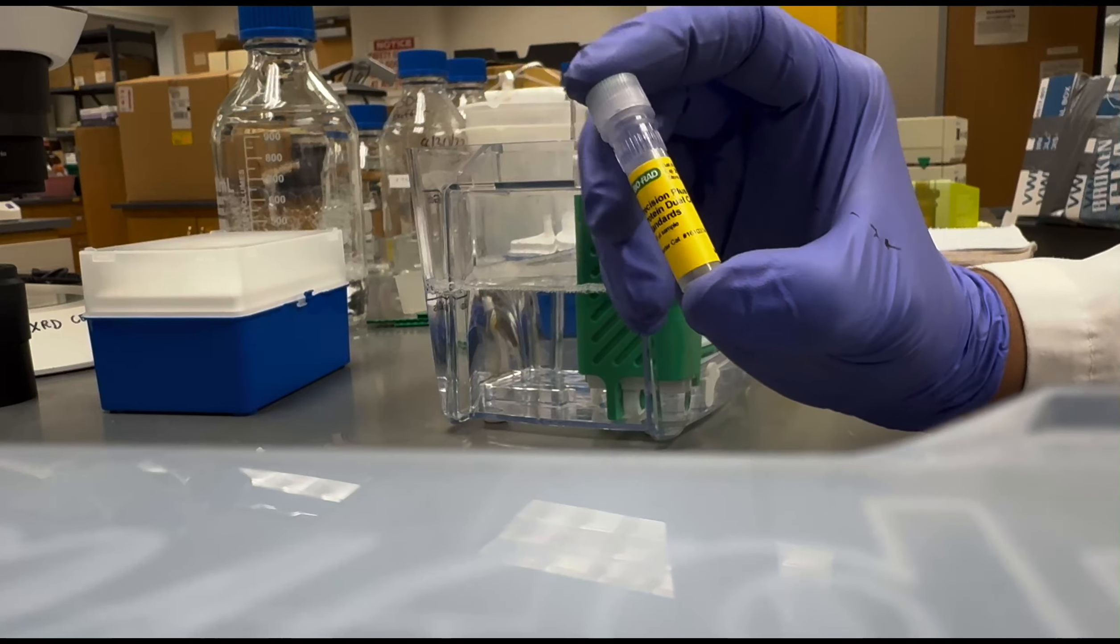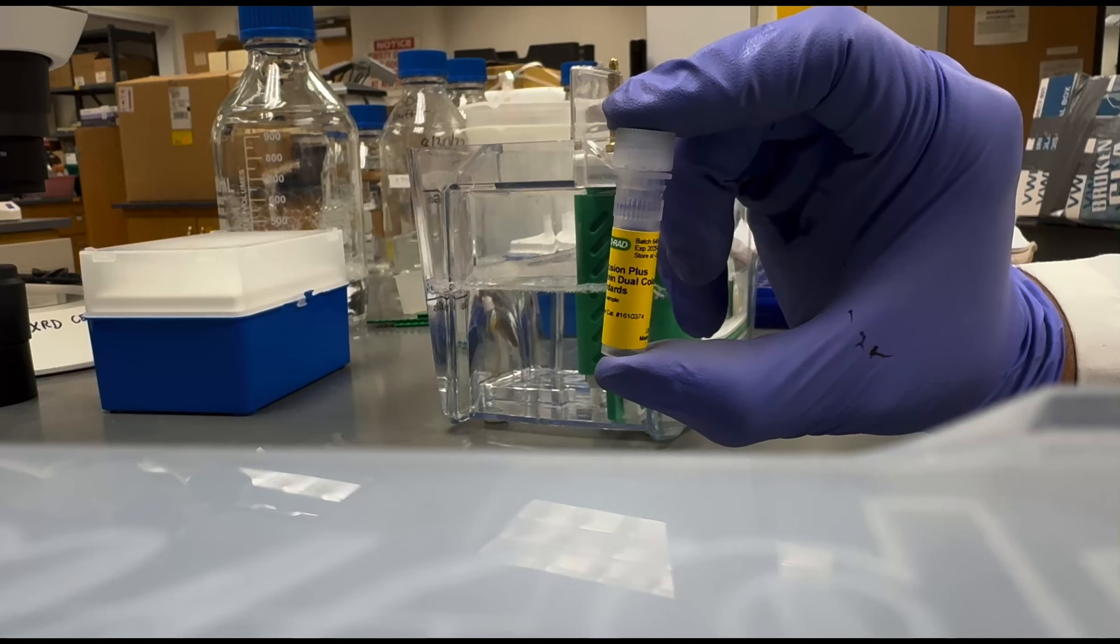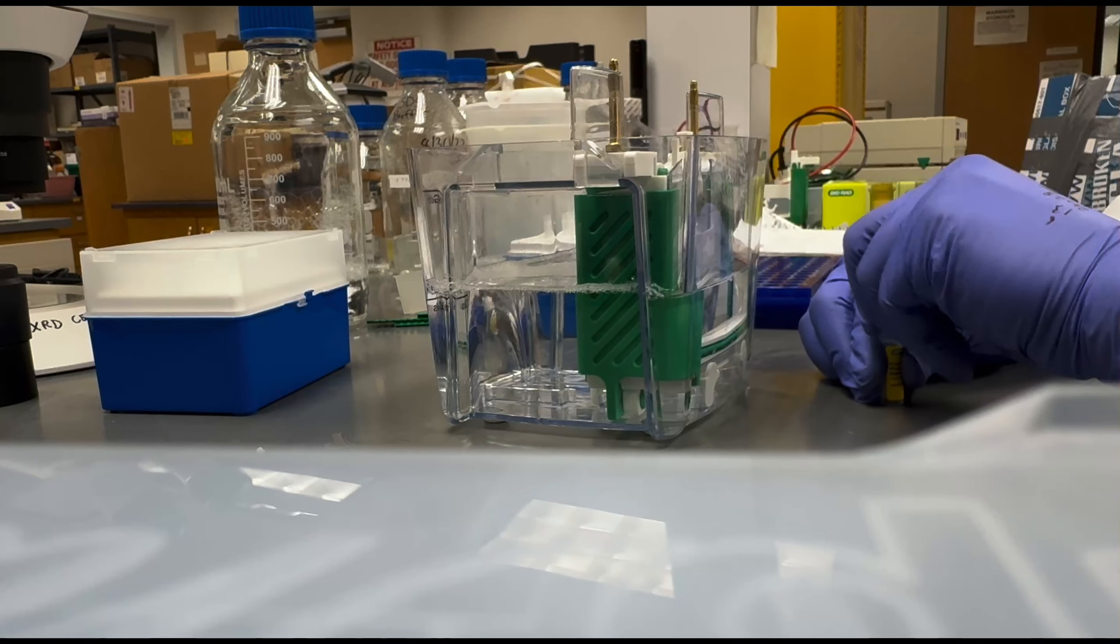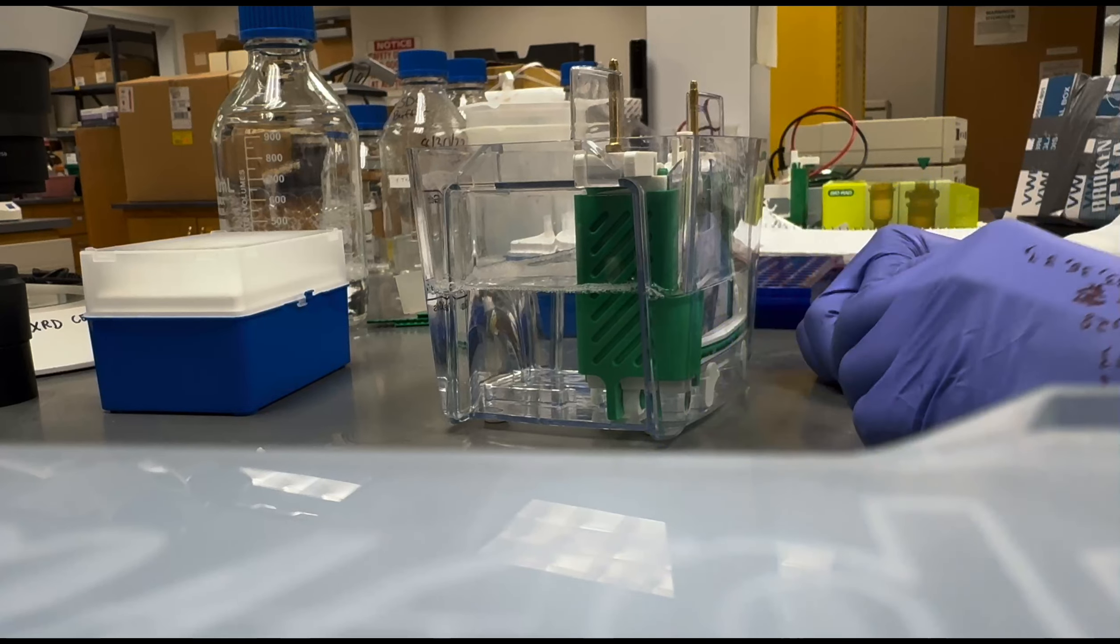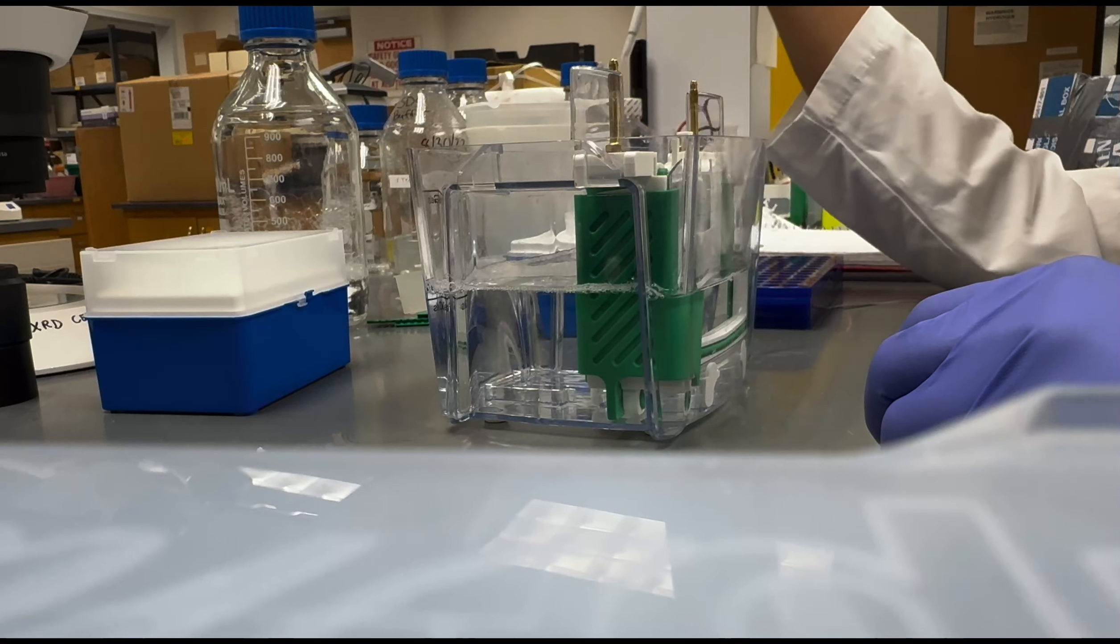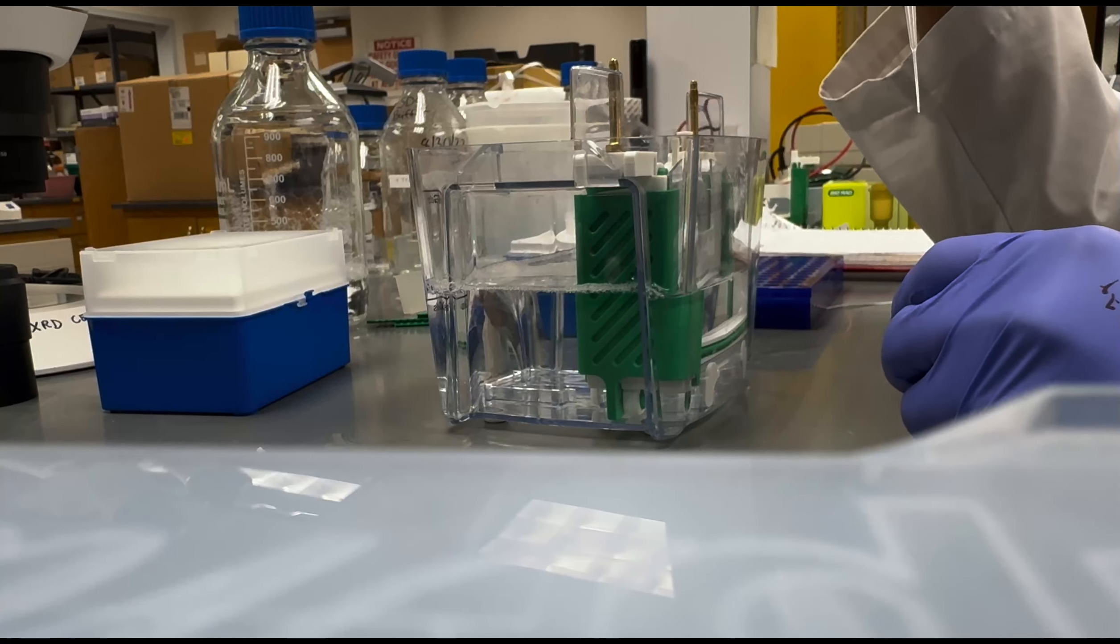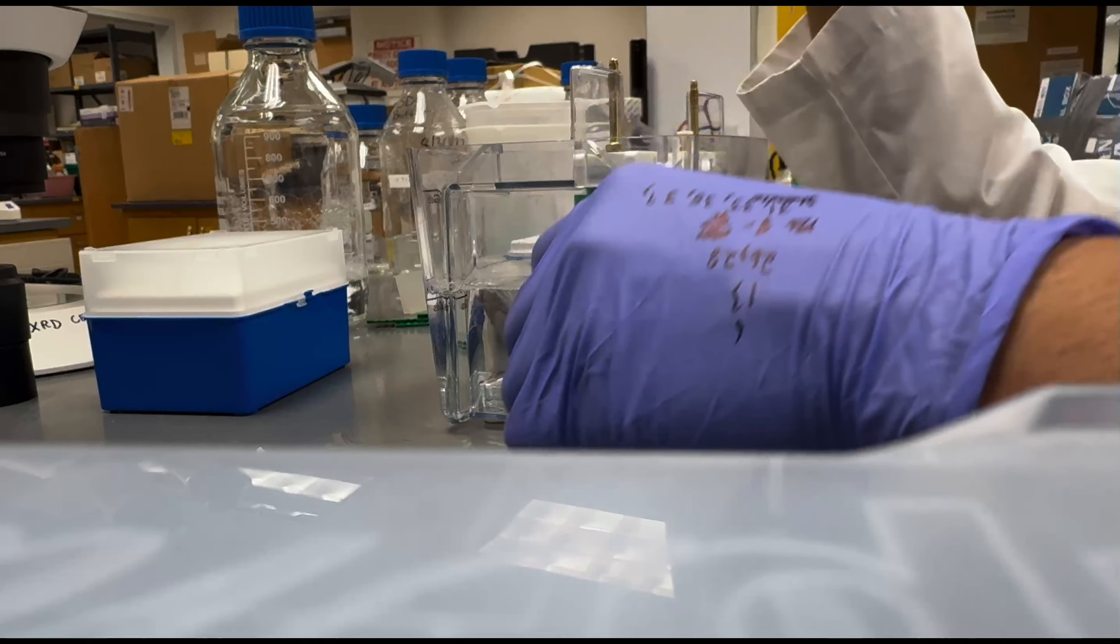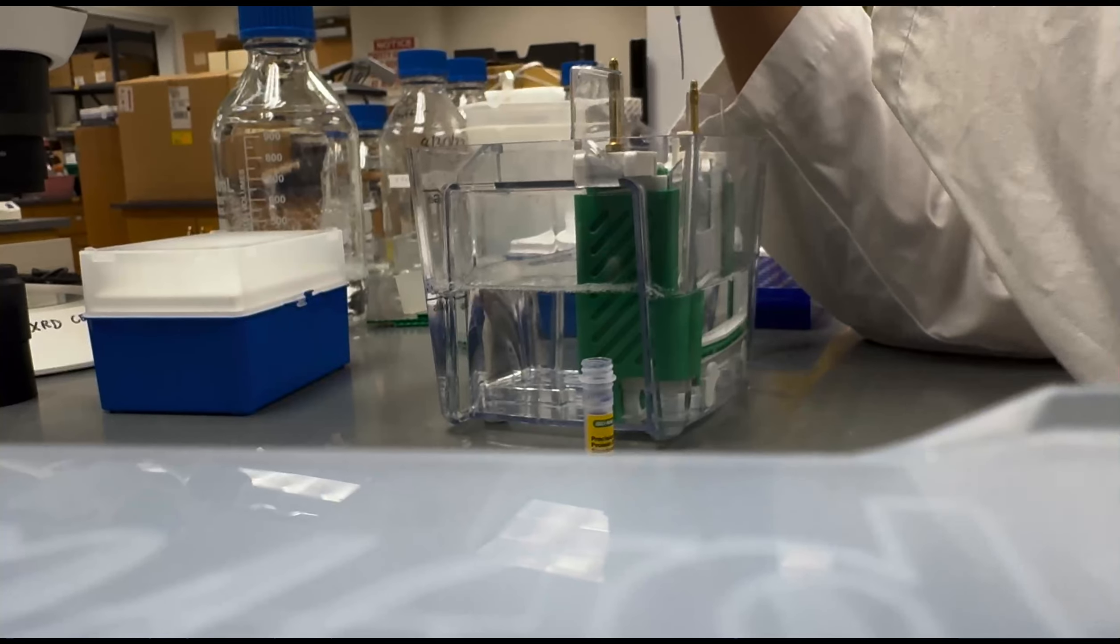Approximately 12 microliters of sample solution are loaded into their appropriate wells and approximately 7 microliters of a molecular weight standard are loaded into a separate lane as well. The addition of the molecular weight standard allows for the characterization of size between proteins in each of the samples. Ultimately, this will allow us to identify our desired protein in each of the samples.